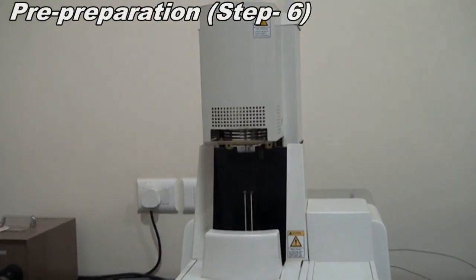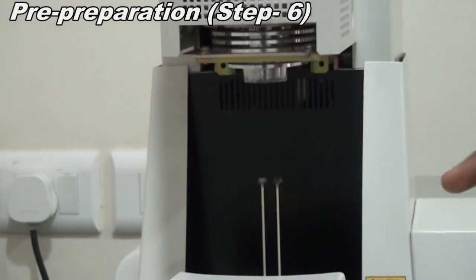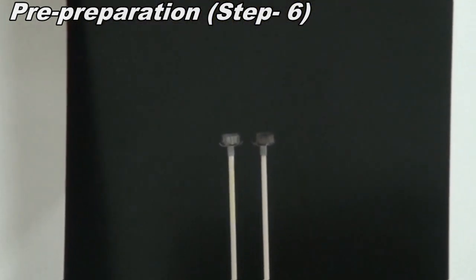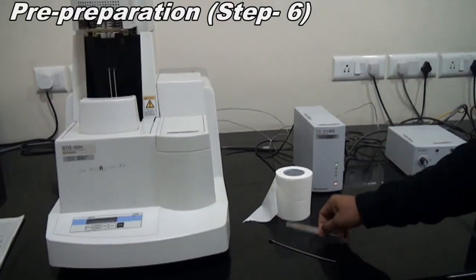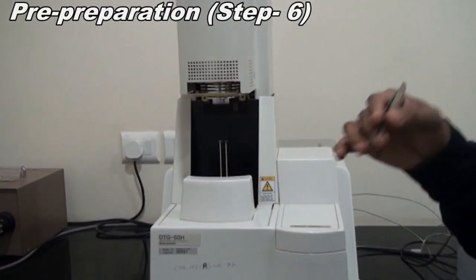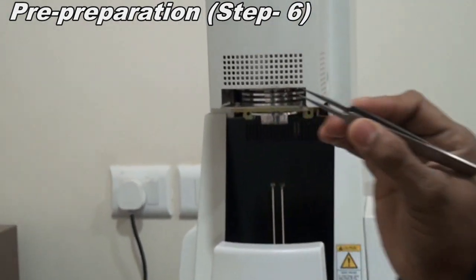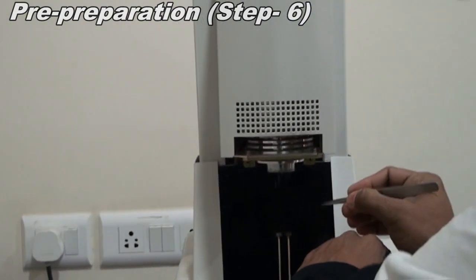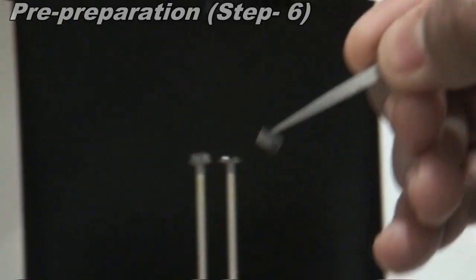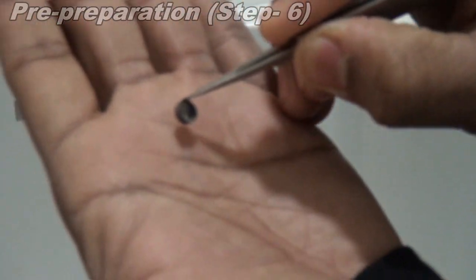You need to check whether the pans are clean or not. To lift the pans, you need to use the forceps to lift them up, take them out, and place them at the backside. This is how you handle them. These pans are very small and very sensitive. I have just taken out the sample pan; it is a very small one and it is clean.